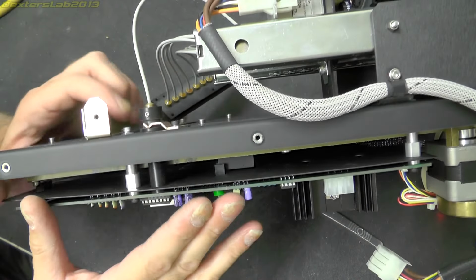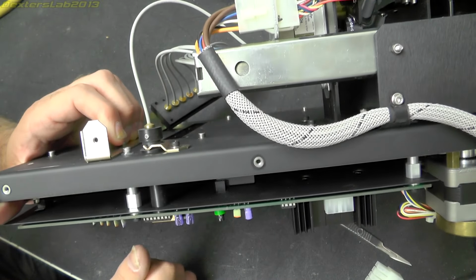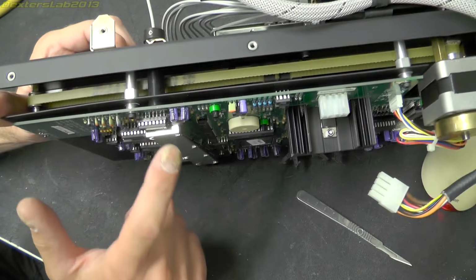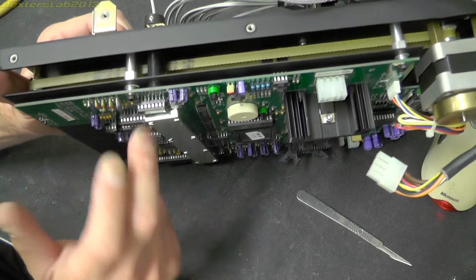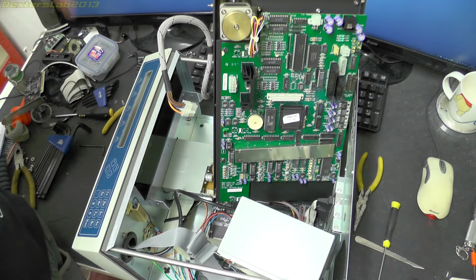And one last thing that I've seen is this optical fiber here, which is completely separate to the diode array. That comes through this pipe here, and there seems to be a diode mounted to the PCB here. I would imagine that's probably for some kind of calibration. Right, there we go. There's nothing more to see.